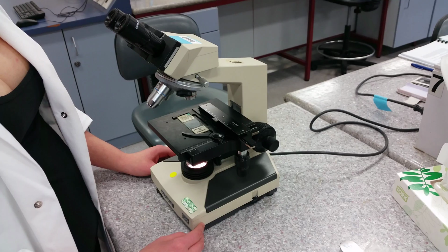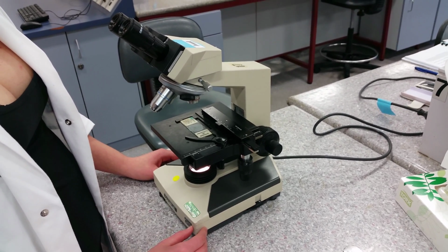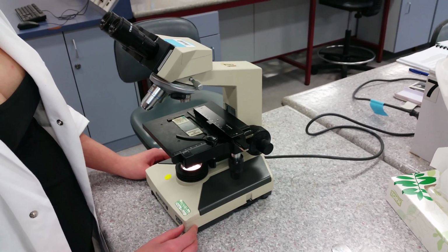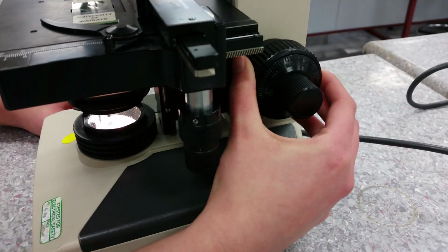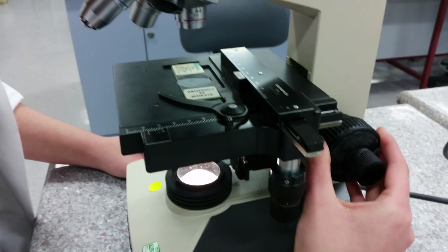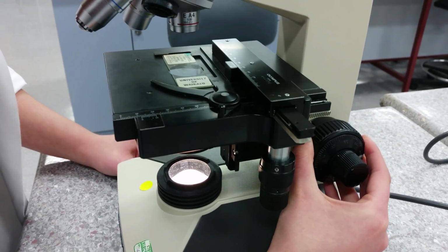Next, the sample must be magnified properly and brought into focus to view the region of interest. Focusing means obtaining a clear image that isn't blurred. This can be done by using a coarse adjustment knob. The big one. This brings the objective closer to the specimen.